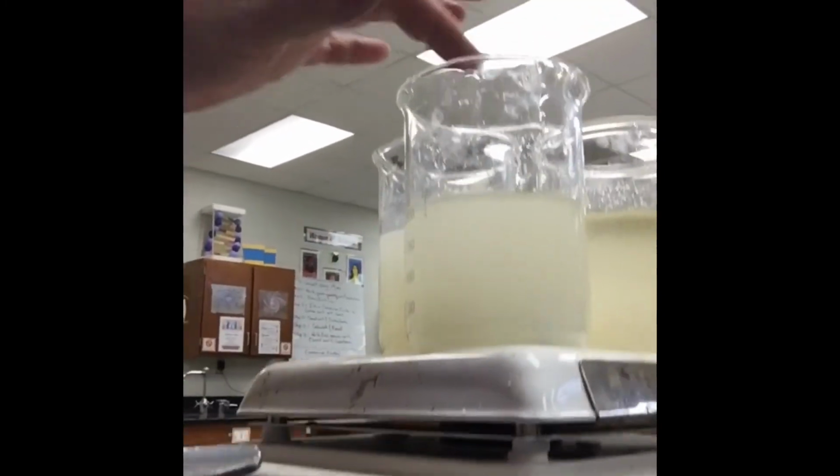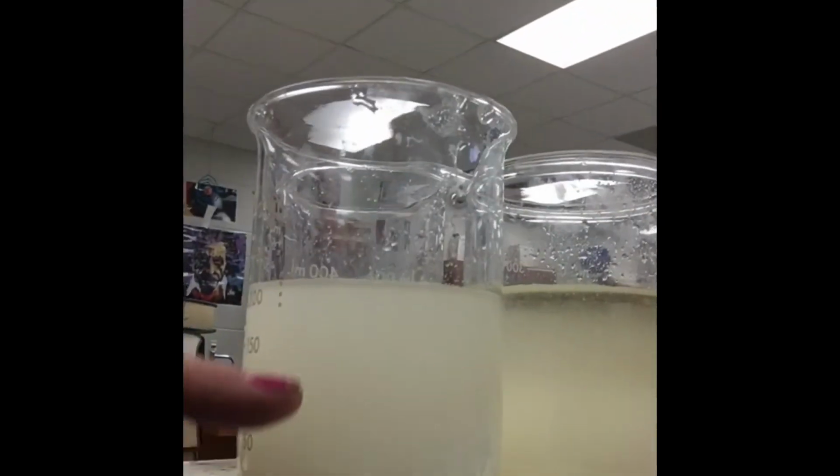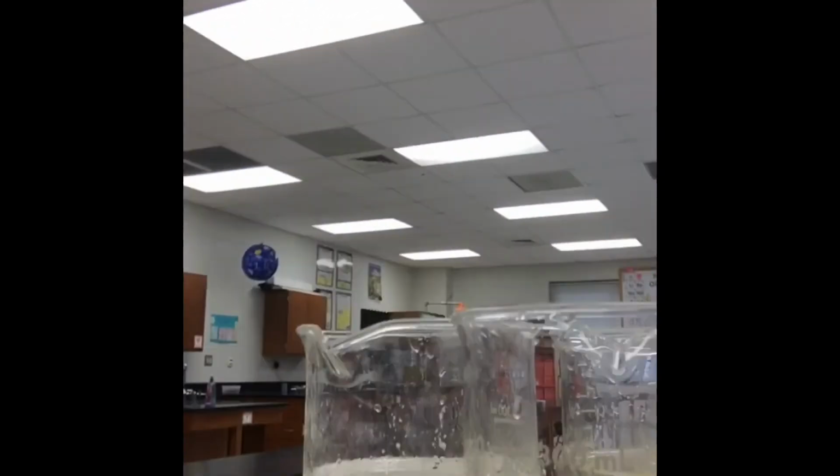So it's been about half an hour since I put my sugar water in and started stirring, and I got really tired of stirring. So I actually set up my little electronic stirrer, and it's just a stir function, and then you drop a little magnet into your solution, and it rotates the magnet around and stirs it at the bottom, so you can kind of see that magnet in there. So I just have my 3 beakers on there, and that's been stirring a little while, and I can see that they're a little bit less cloudy than they were, which tells me that the sugar is slowly dissolving in them. So I'm going to call those solutions saturated. They might be oversaturated, but I'm going to call them saturated.